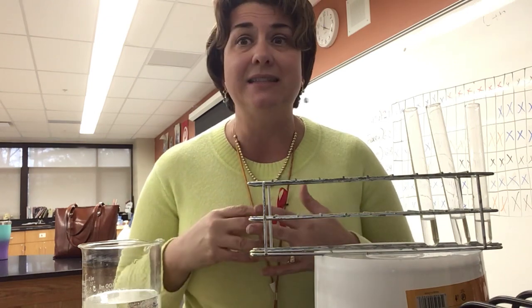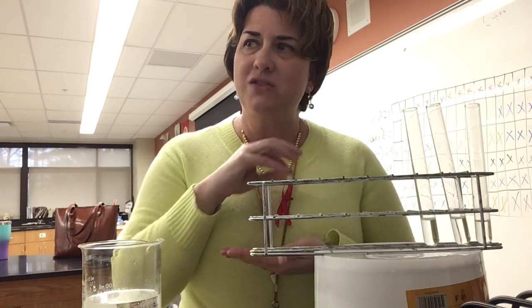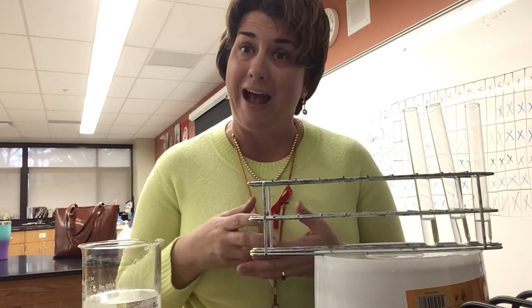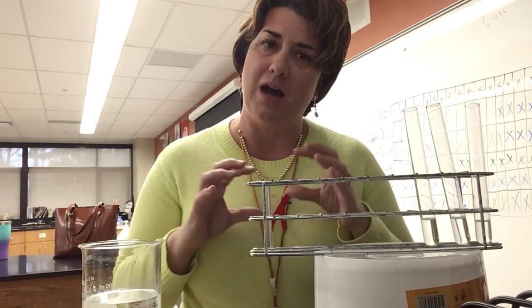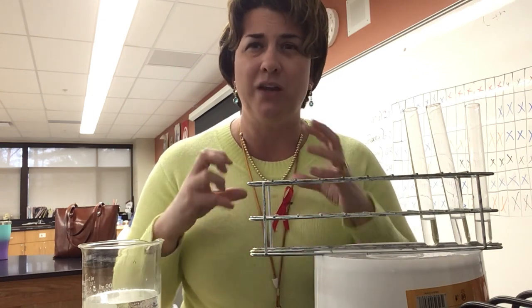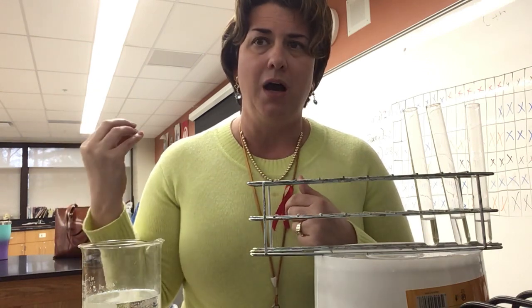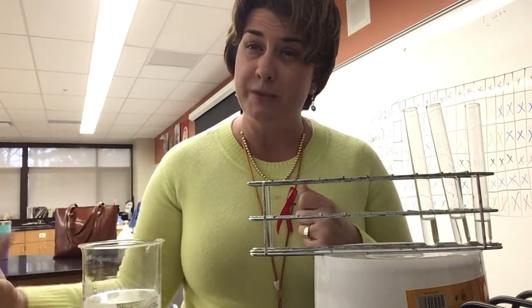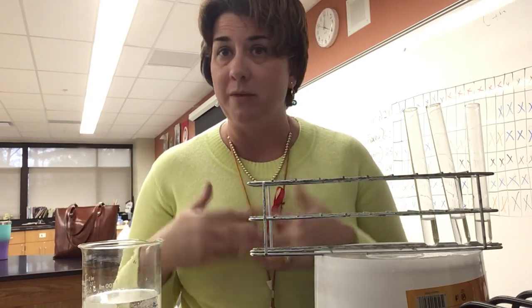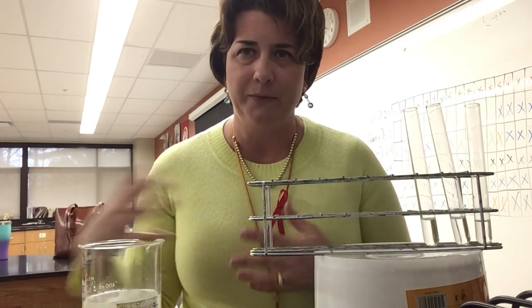The last test is the paper bag test, where we put the solution onto a brown paper bag to test whether we have the presence of fats. If fat is present, the spot on the paper will not dry, and when we hold it up to the light, we'll be able to see the light through. I describe that as translucent. If we don't see the light coming through, we know fat is not present, and we would describe that as being opaque. All right?